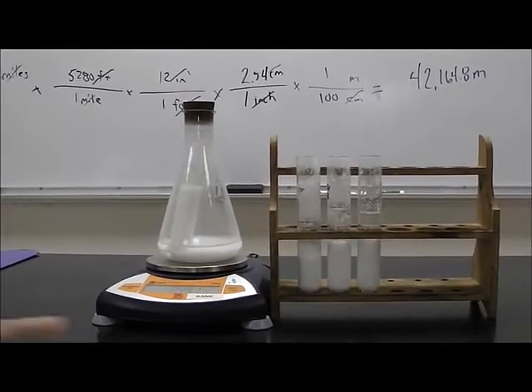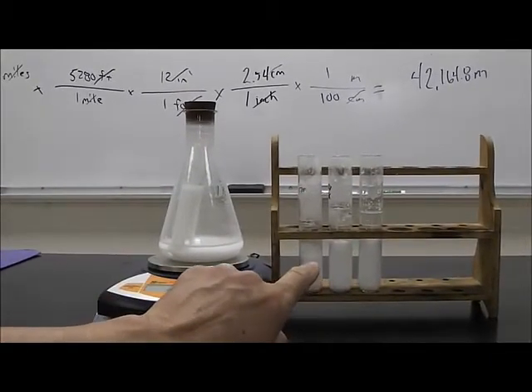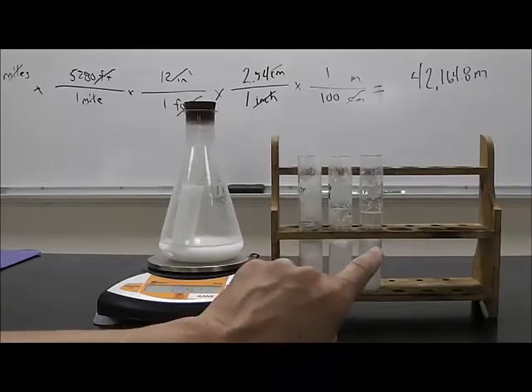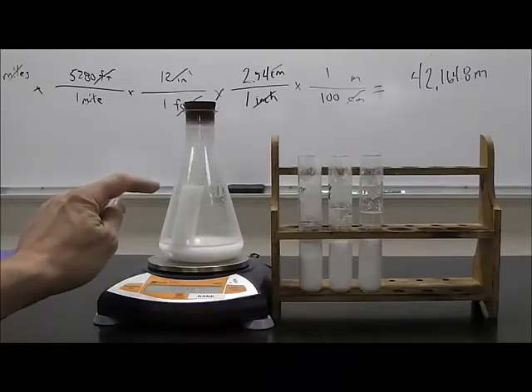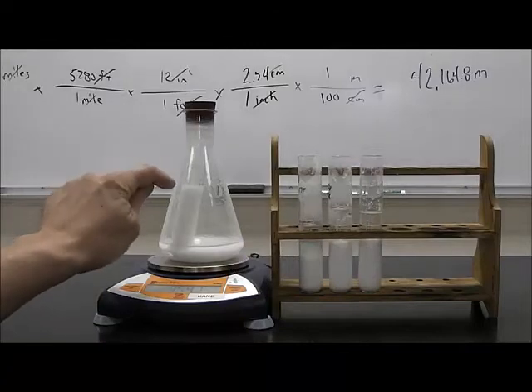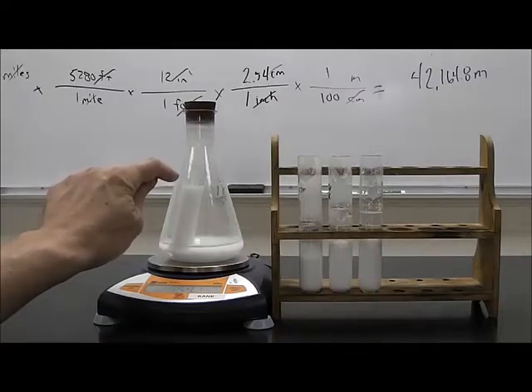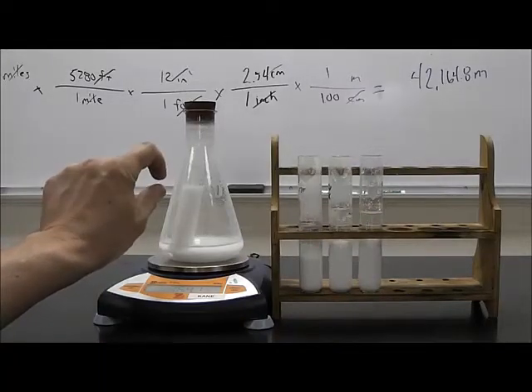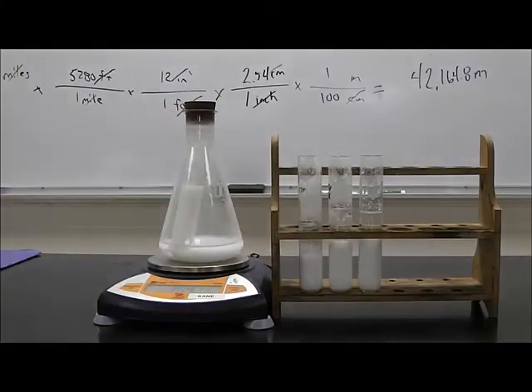As you can clearly see, six hours ago is lower, four hours ago, two hours ago is a little bit higher. And right now, you can just barely start to see that the precipitate is occurring here. We're getting a slight colorless solution at the top.